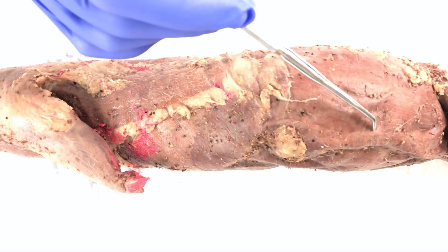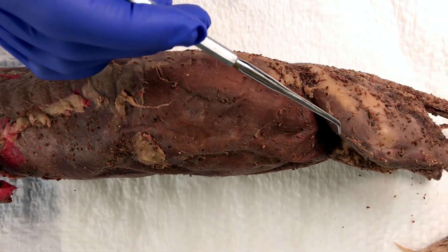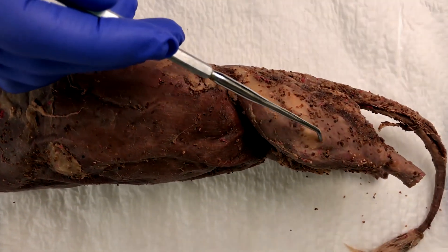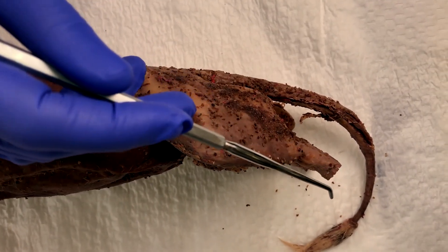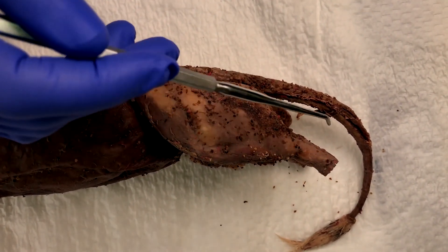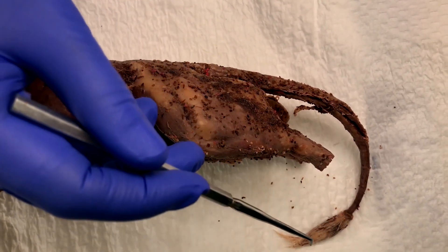As we continue down the animal, we reach its hind leg. You can see where its hind paw would have been. The mink's tail is still intact.